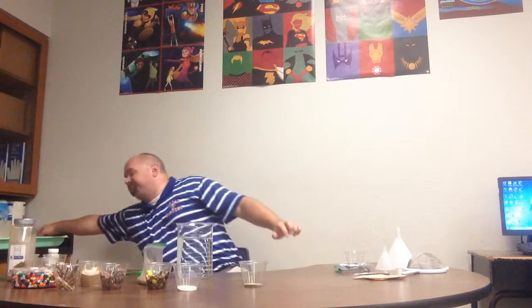So, what I'm going to do is I'm just going to use this cup. Now, I put 5 milliliters of salt and 5 milliliters of pepper in here. So, it's a pretty good little mixture. And I'm just going to fill this cup up, not completely full, because I don't want it to spill and make a mess. But I'm going to fill it up pretty close to the top. Now, I need to stir it up so that I can make sure that the salt is dissolving inside.